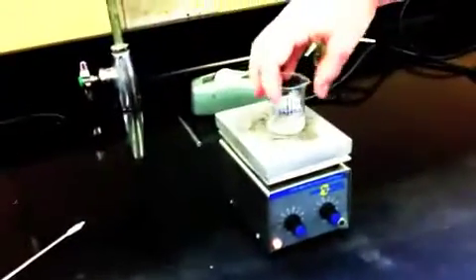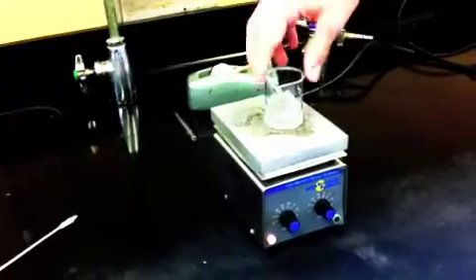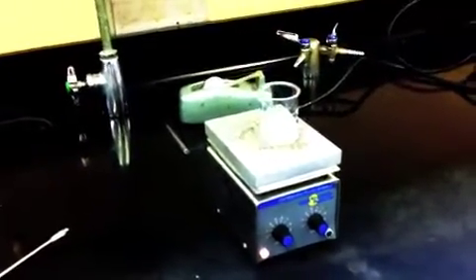And the hexane, excuse me, doesn't really do anything because it's already all dissolved. So if you heat it up, you can't really dissolve anymore. So that didn't do anything.